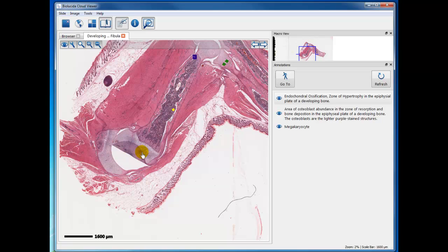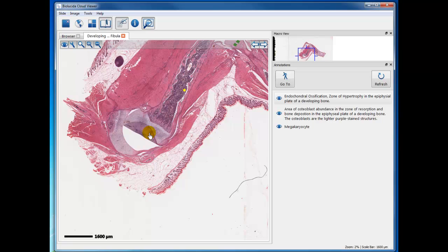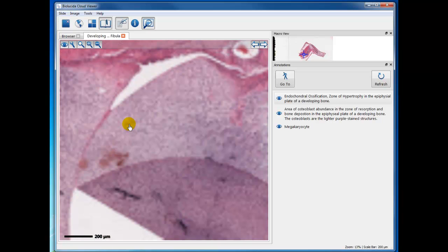first. The epiphysis here, when the tissue was mounted on a glass slide, this portion of the epiphysis lifted up and folded over. So in any histological specimen, we may have knife marks, we may have tears, and we may have folds, as you can see here. So this is part of the epiphysis of another bone here, articulating with the epiphysis of this bone.